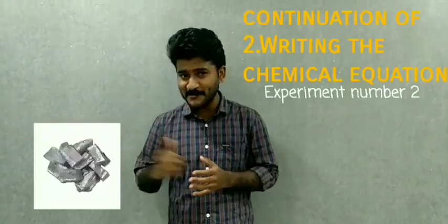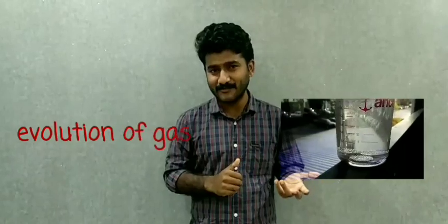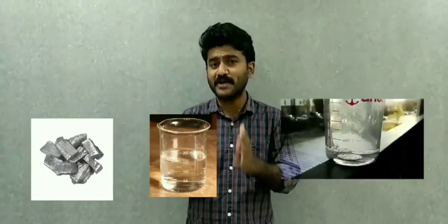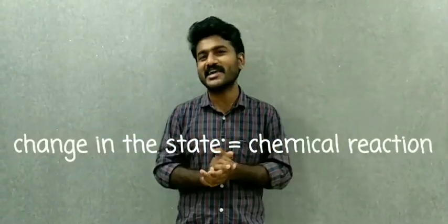Let's consider a second experiment. Here we have zinc metal and next one is hydrochloric acid. When we mix them together, we can observe bubbles being produced, and as we already said, if there is evolution of gas, we can conclude that a reaction is happening here. Here bubbles are produced, that means a chemical reaction has happened, and we added one metal into an aqueous solution, not liquid, aqueous solution, and it became bubbles, meaning a change in state has happened. That means the chemical reaction has happened.